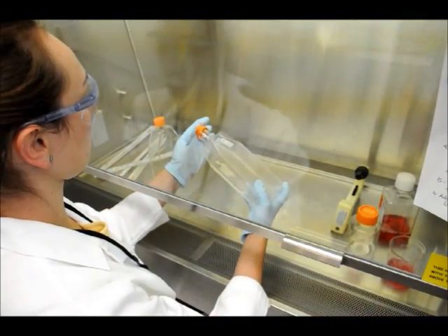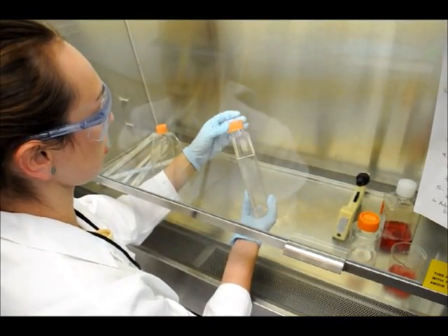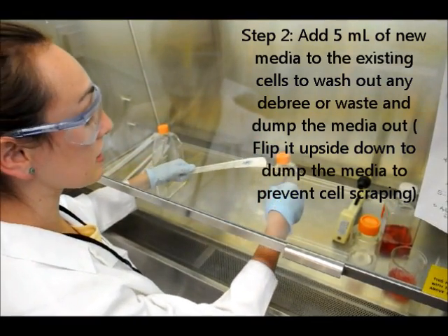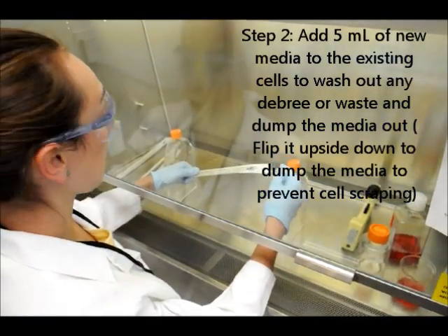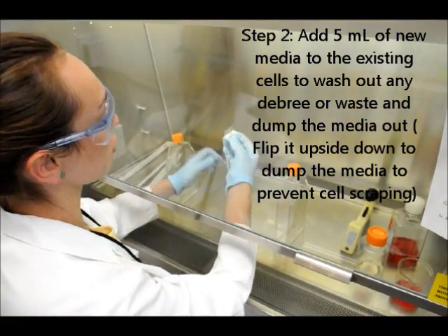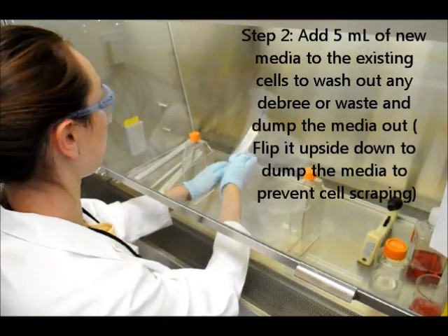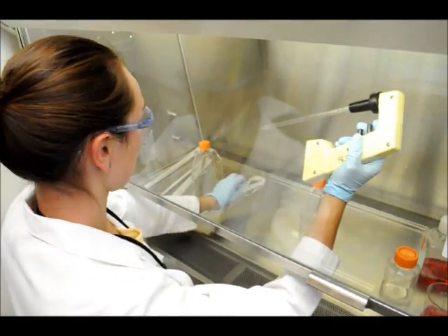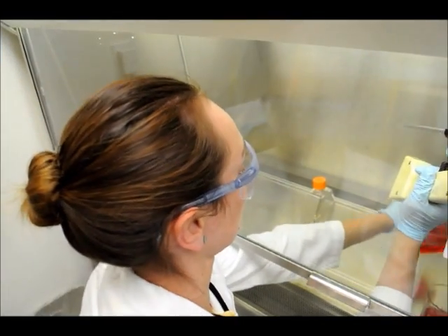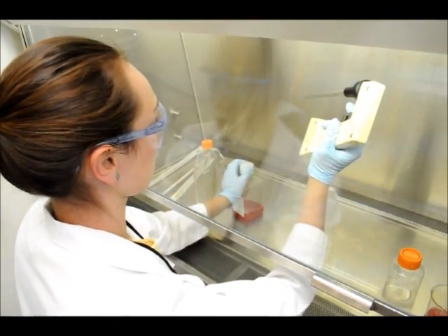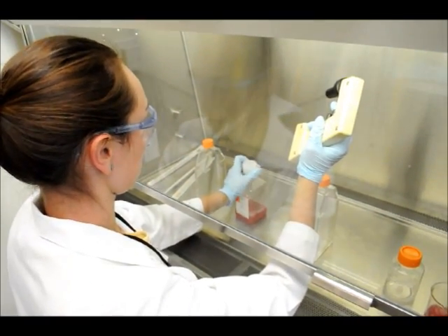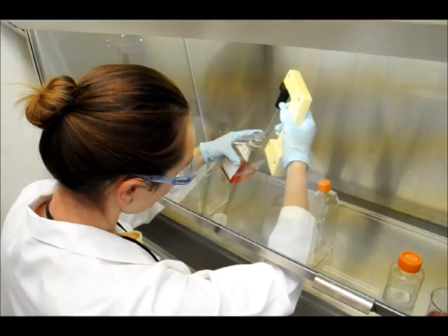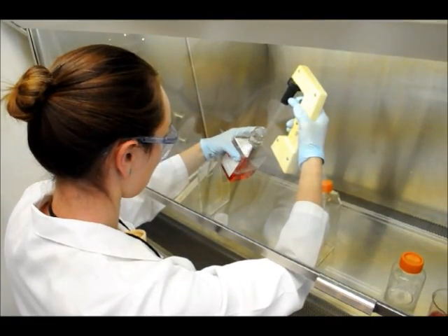Then you are going to get a 5ml pipette and you are going to rinse the cells with the pipette and some new medium. Make sure you don't touch the pipette with your hands if you can avoid it. Just get it all over.